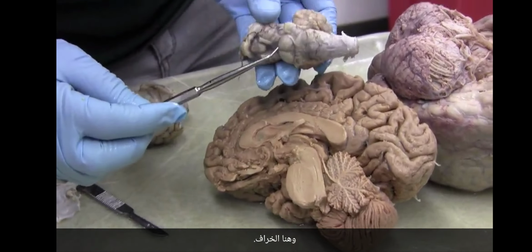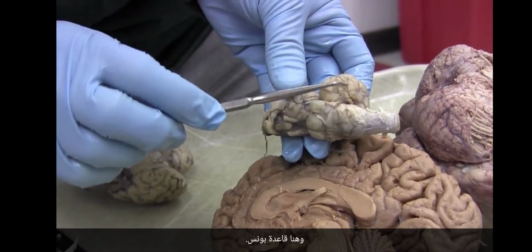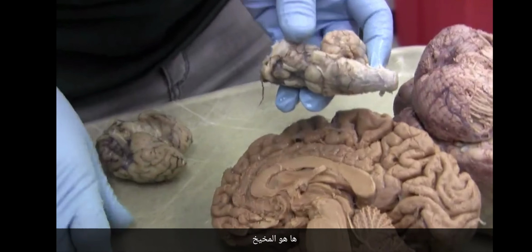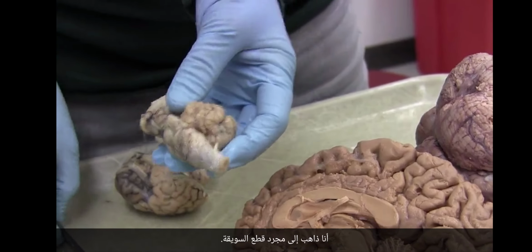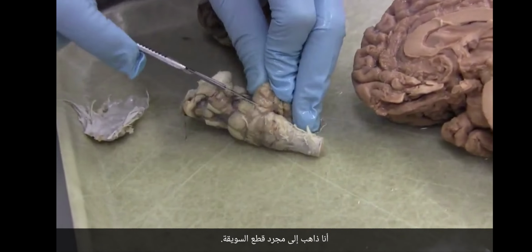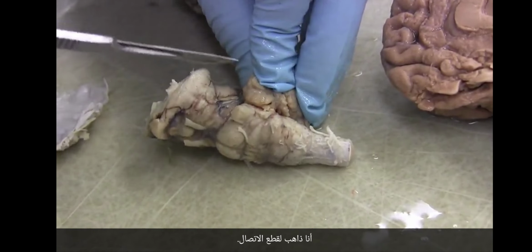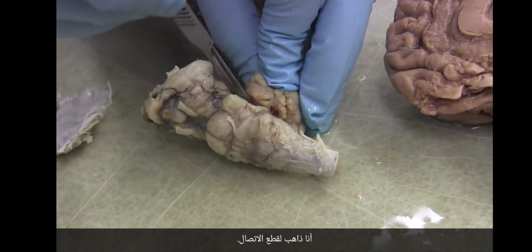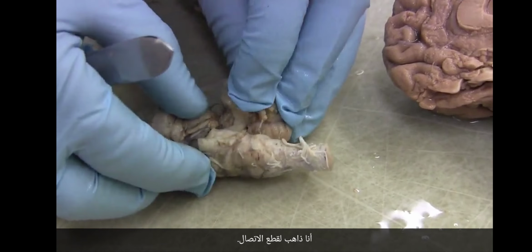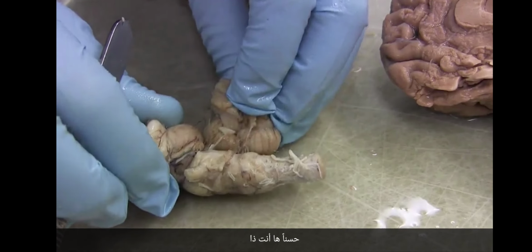And here's the sheep. Here's the base of the pons. Here's the cerebellum. They're both connected. I'm going to just cut off the peduncle. I'm going to cut the connection. Okay, there you go.